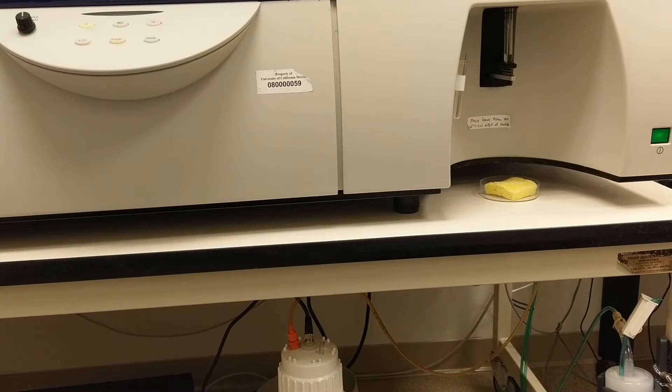A third one that happens quite often is people just don't have any cells in the tube. They think they have cells in that sample but there are actually no cells in there. So try again, try another tube you know has cells in it and see if that tube is having any problem. If you've ruled out that your sample is the issue then you're going to want to look at the instrument.